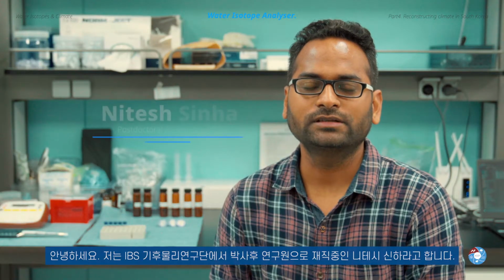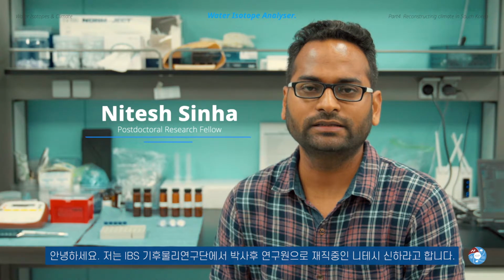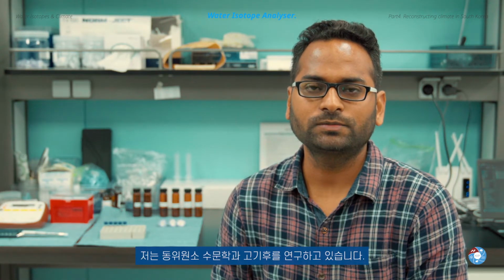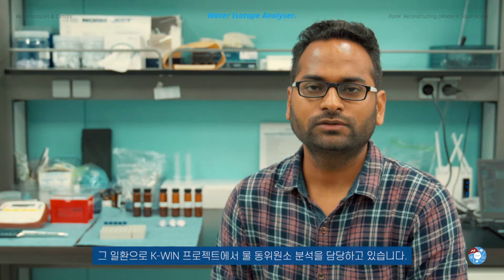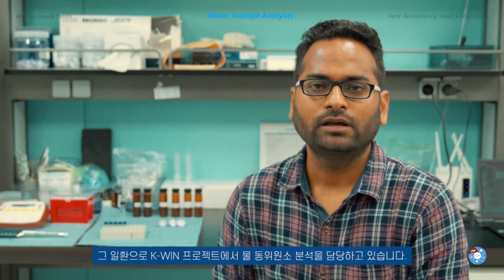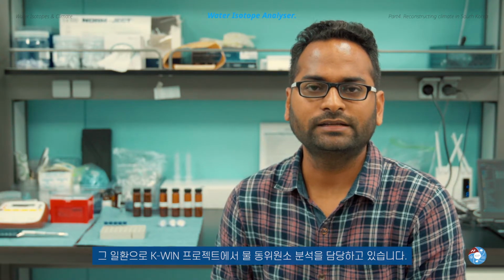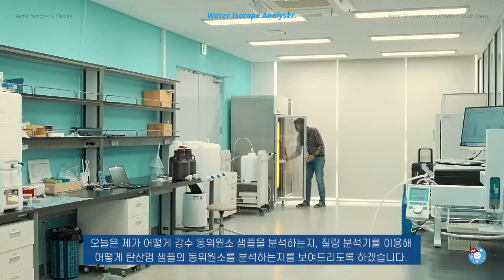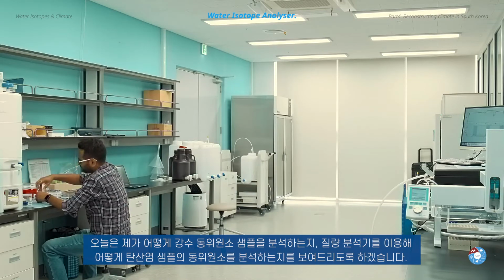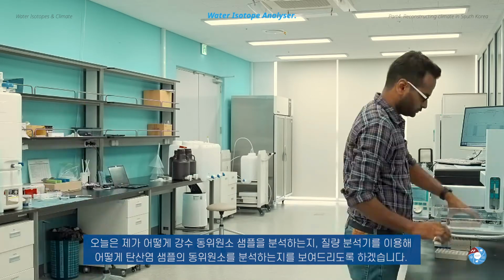Hi, my name is Nitesh Sinha. I am a postdoctoral research fellow here at the center, ICCP, and my research interest is isotope hydrology and paleoclimatology. So as a part of this, I am in charge of the KWIN project, and I will do the isotopic analysis of rain samples. And today I will show you how we do the isotopic analysis of the rain samples, as well as how we do the isotopic analysis of a carbonate sample using a mass spectrometer.